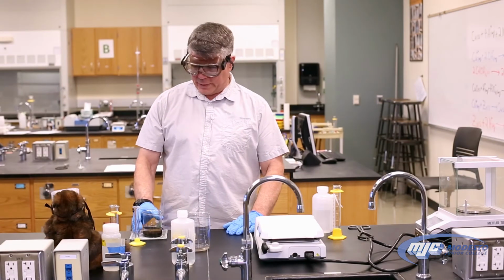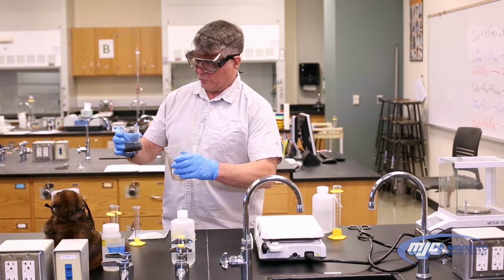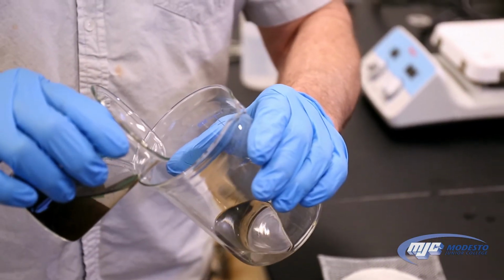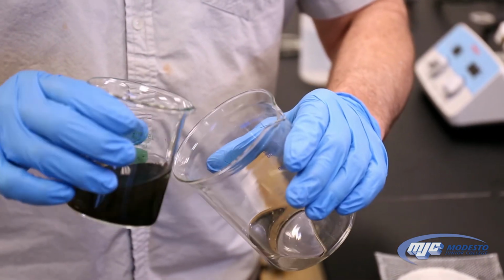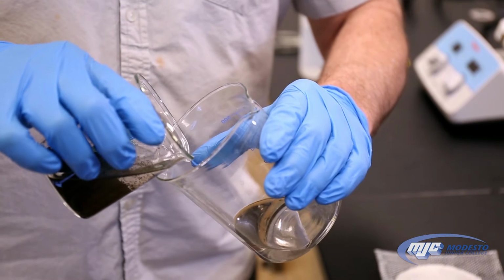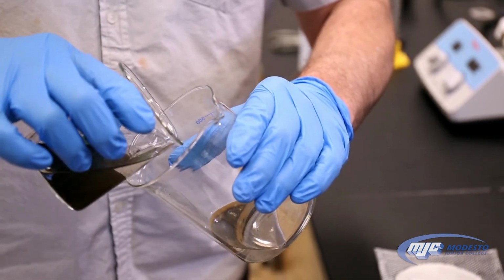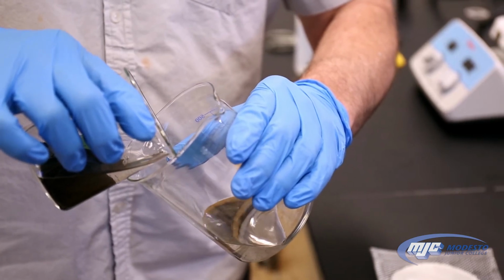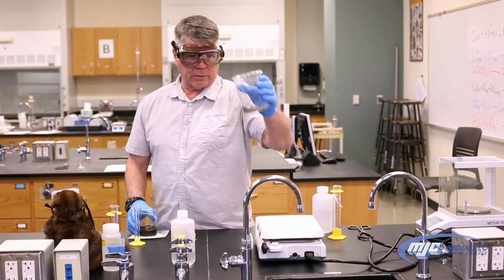All right, guys, so now that we gave the copper 2 oxide a chance to settle down, we're going to decant the last washing off the top. Again, we really don't care about getting all of that liquid out. Our goal is just to try not to let any of that, or as little of that copper 2 oxide get transferred over as we can. Yep, a little piece went over. I'm going to call that good enough. So now this, we can just throw down the drain.